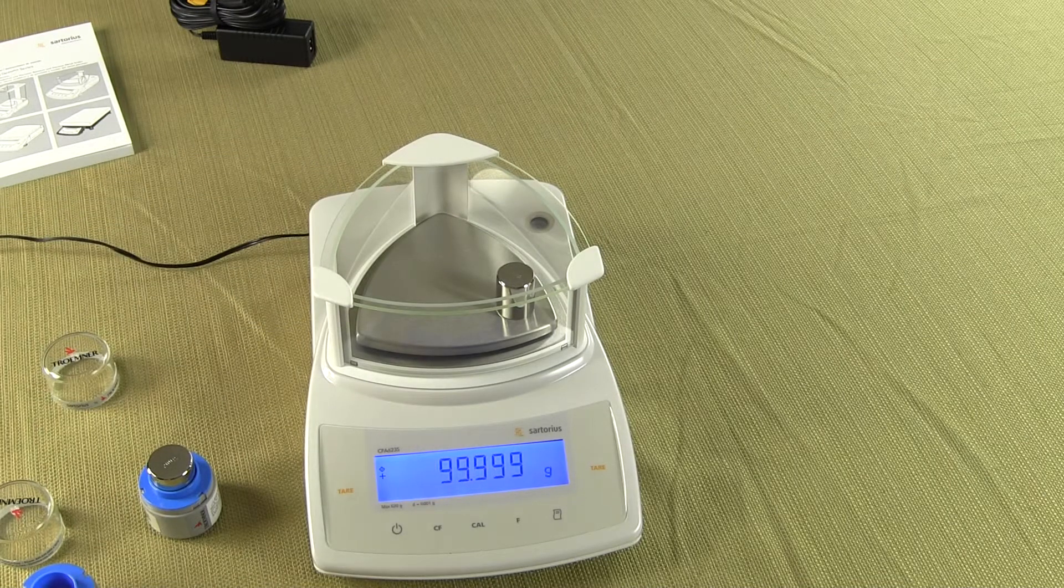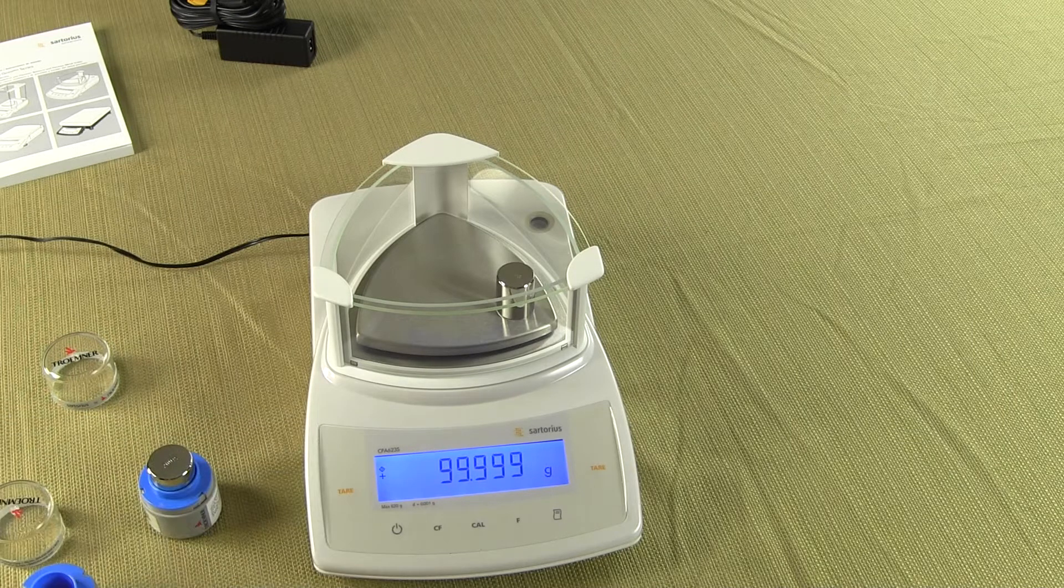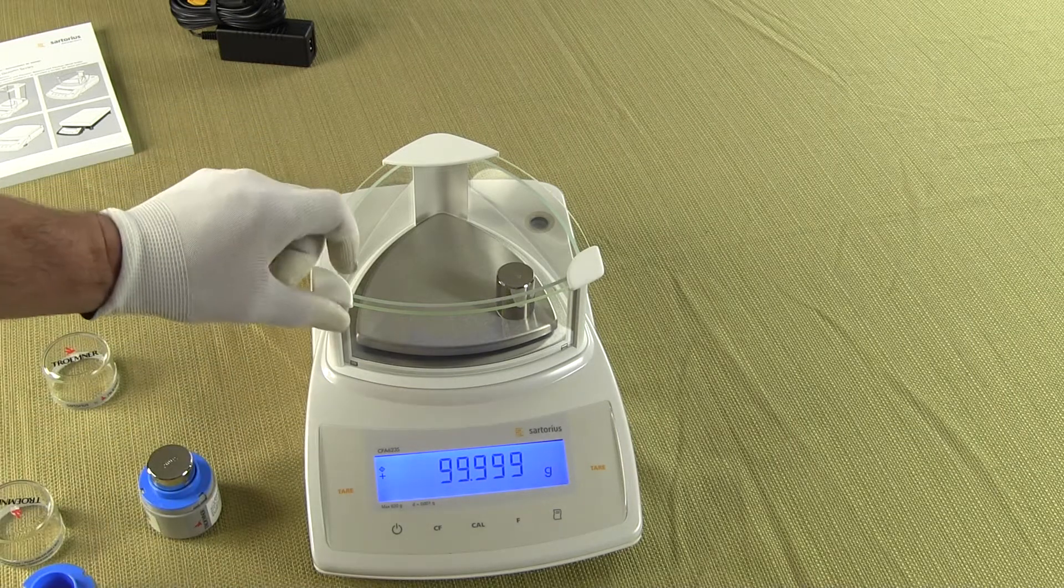Sartorius is top of the line and it is known worldwide for its quality and performance. When I put on this calibration weight I'm putting it on in the corners and you can see the balance plus or minus, now we're a milligram each corner.